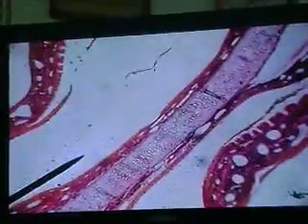This is quite a nice slide of the nasal cavity. You can clearly see the nasal septum, which is partly bone and partly cartilaginous. So we know we are near the anterior end of the nasal cavity — this would be the nasal septum going into the area nearly of the vestibule.